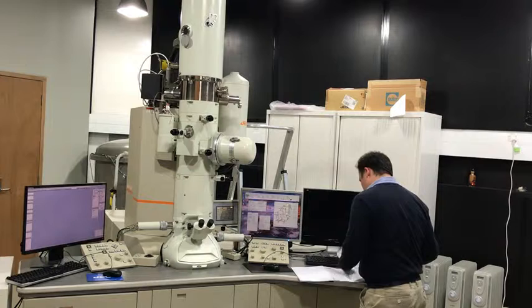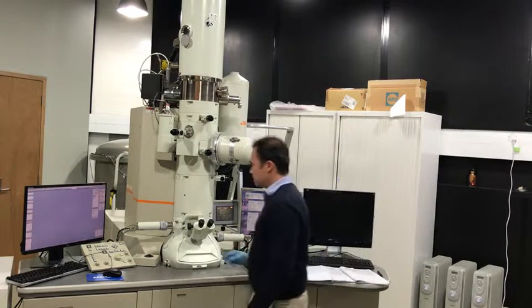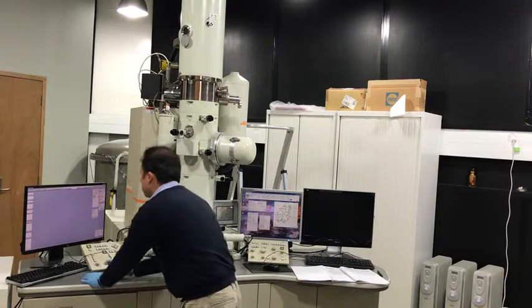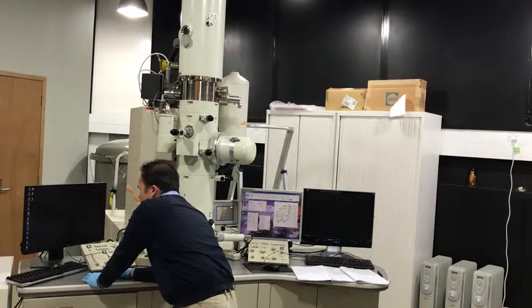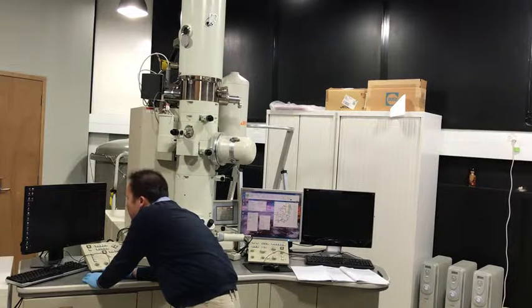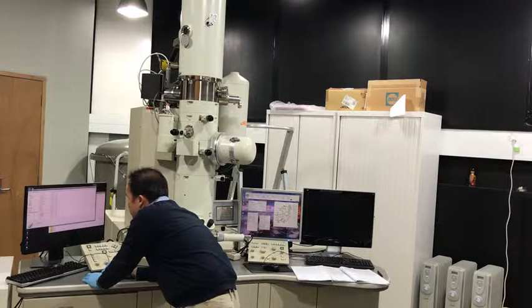So the logbook's completed. Now before I do the final stage, I'm going to transfer our data to the N drive. So I'm going to our folder, users. There we go, and here's the public storage. So I'm just going to put MTE, where is it?